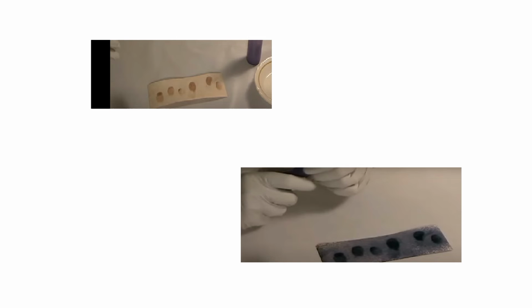If we have the details of the persons with the fingerprints, then we can compare them using a magnifier. If you have a camera, you can take a photo of it immediately and scan it, and if you have fingerprints in the computer system, you can then compare them with the persons. So this is the practical, that is how to reveal latent fingerprints, the fingerprints that are not visible to our eyes, using iodine fuming.